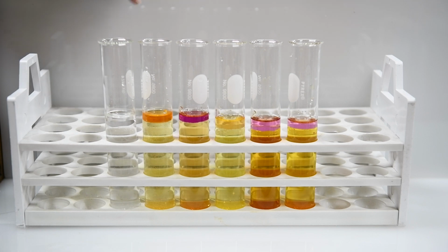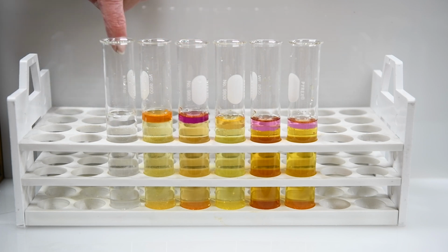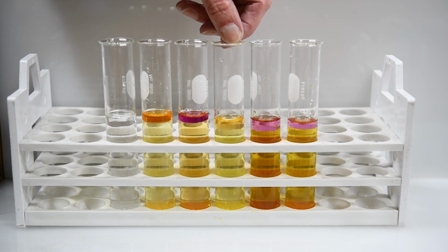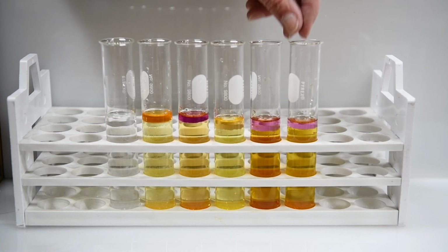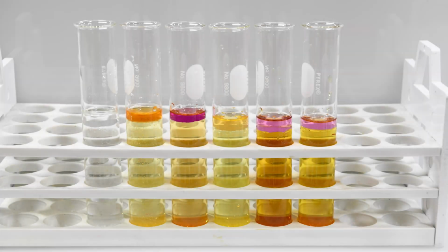So the first 3 test tubes were our pure chlorine, pure bromine, and pure iodine. The colorless, the orange, and the violet. And then in our actual reactions, we clearly formed bromine in the first reaction tube, and we formed iodine in the second tube. So that concludes all of the reactions for experiment number 9. We have the 7 reactions we did with the metals in part A and the 3 reactions with the nonmetals in part B. So go ahead and use your observations from those reactions to answer the questions at the end of the experiment, and then go ahead and submit that.